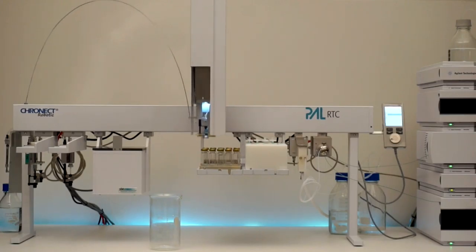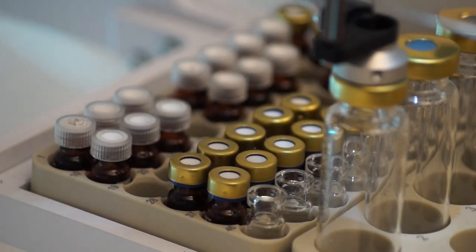Then, the tool dispenses 10 mL solvent to the sample in a 20 mL vial.